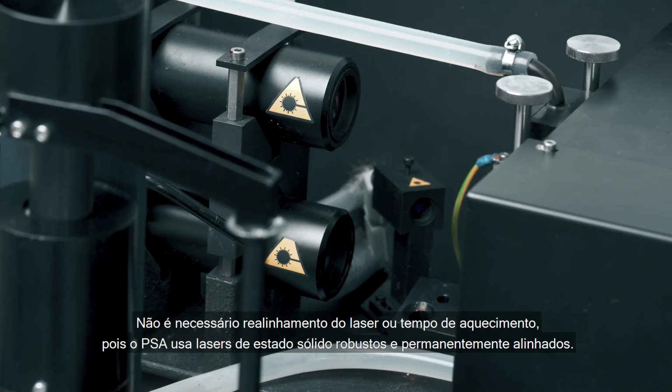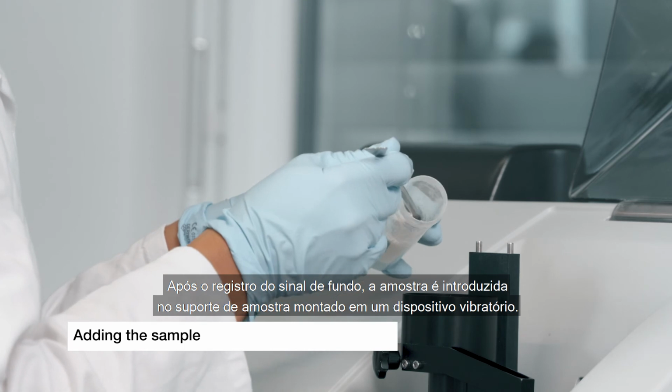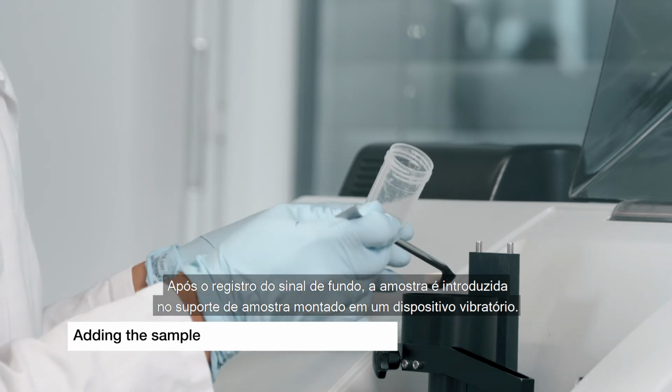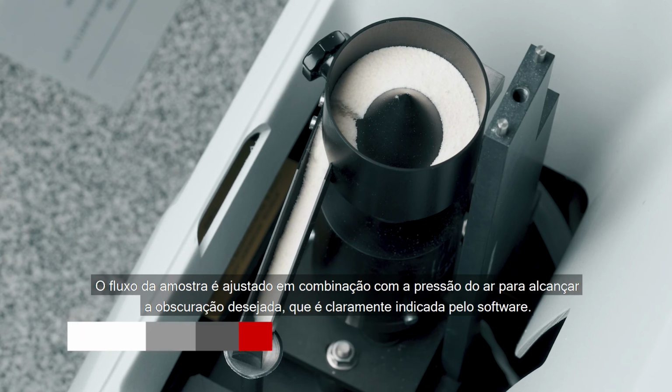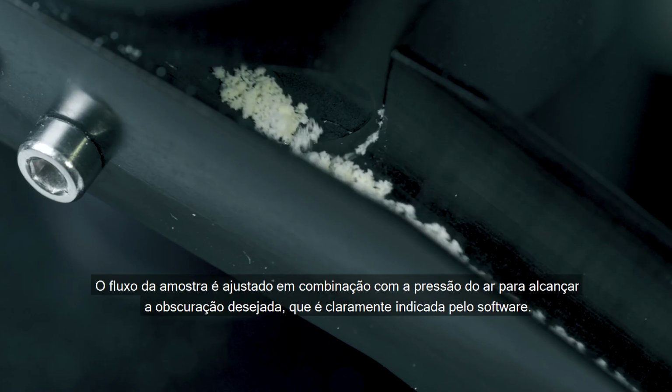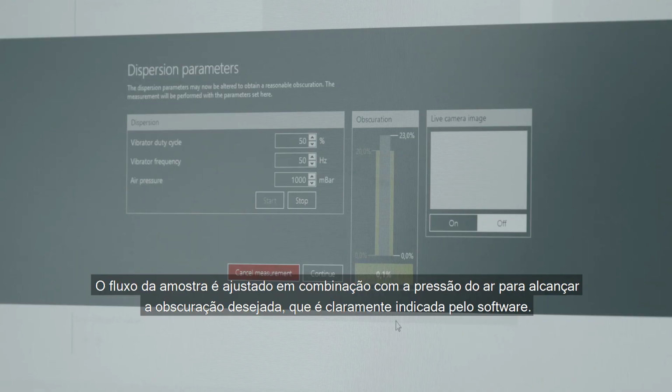There is no realignment of the laser needed or warm-up time, as PSA uses robust and permanently aligned solid-state lasers. After the background has been recorded, the sample is introduced in the sample holder mounted on a vibrational device. The sample flow is adjusted in combination with the air pressure in order to achieve the desired obscuration, which is clearly indicated by the software.